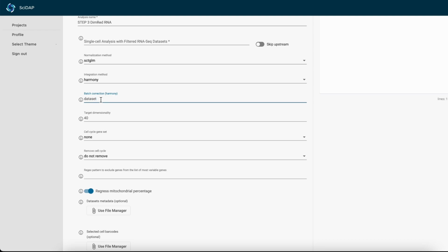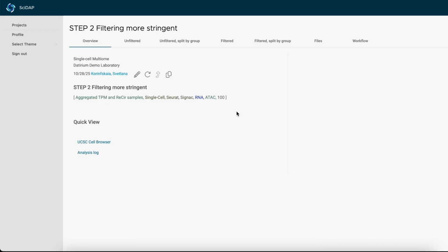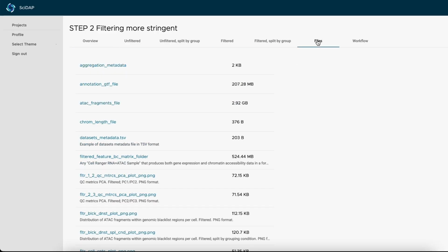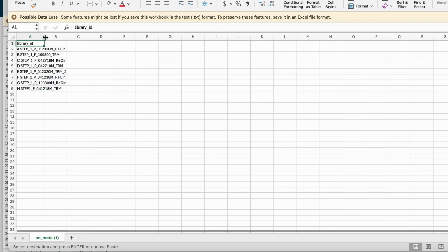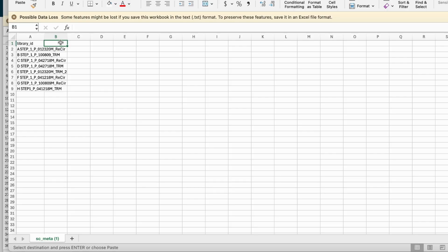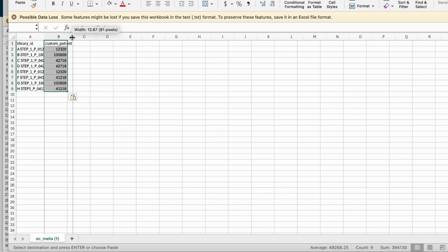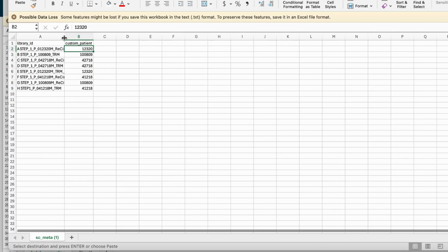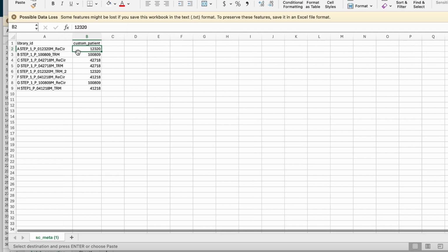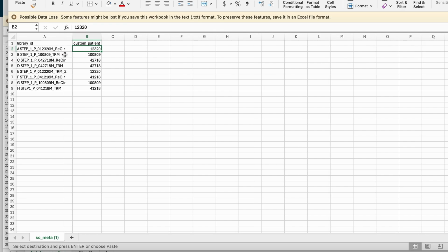And for this, we need to change our metadata. The new metadata file can be found back at the filtering tab. Navigate to the Files tab and search for the metadata file. Here it is. With Microsoft Excel, you can open it. There is a column which will have the information about the donor. It has to be named Custom Patient, and make sure that it corresponds to the files that were uploaded and filtered in this pipeline earlier, in the same order.